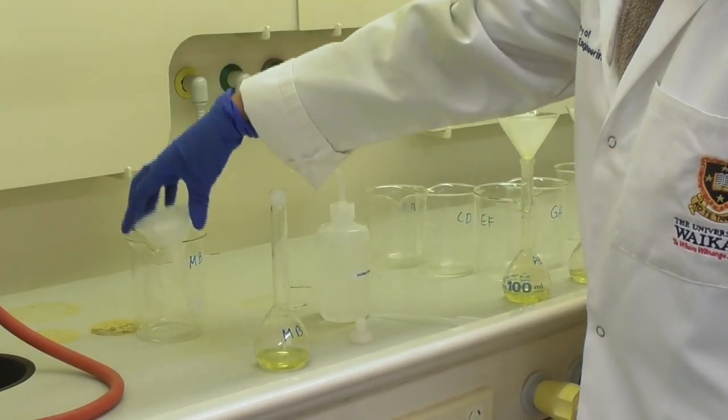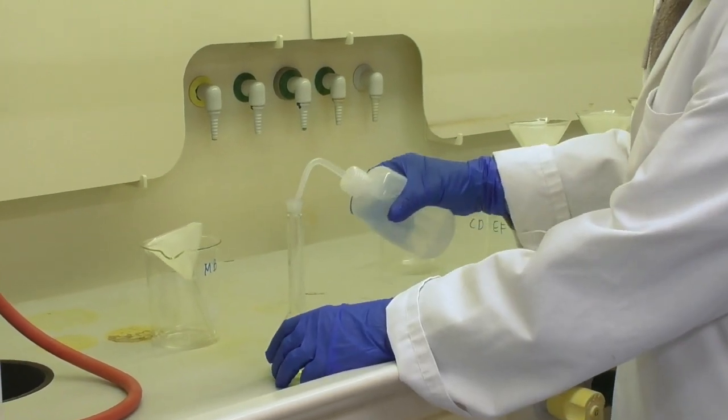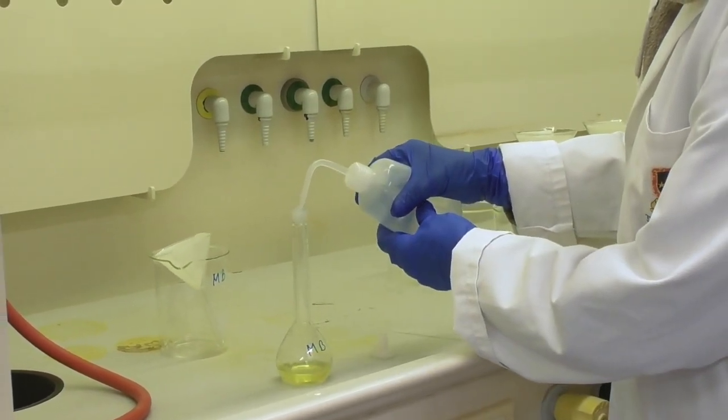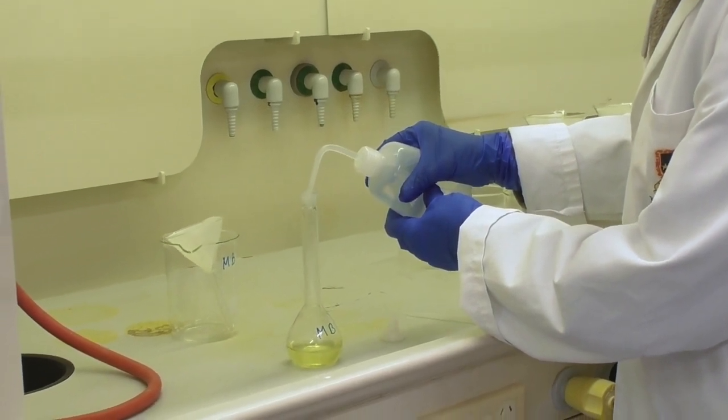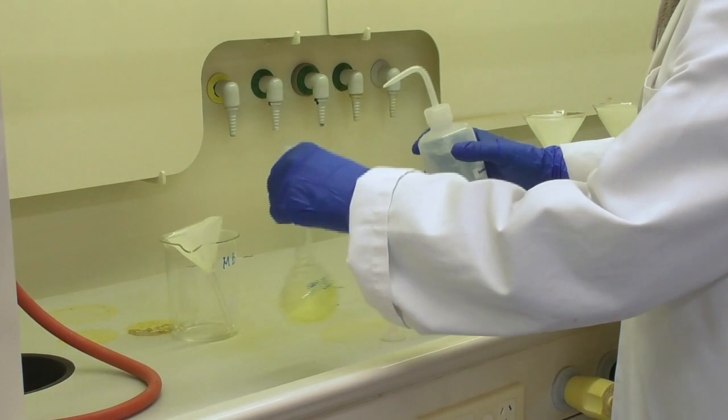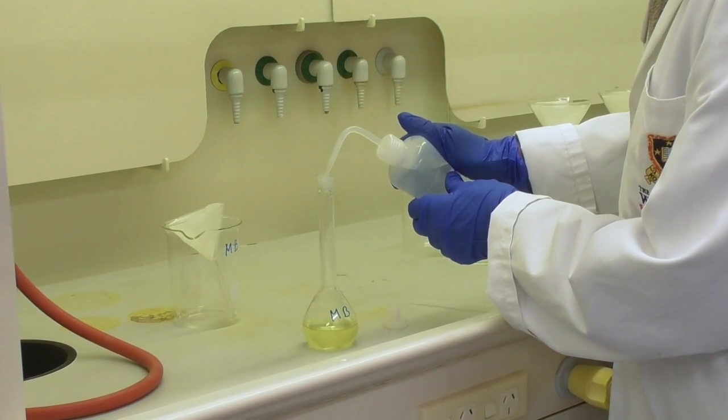I remove the filter and funnel and then fill up my volumetric flask with distilled water to the line. I can squeeze or pour some in, maybe give a little mix towards the end.